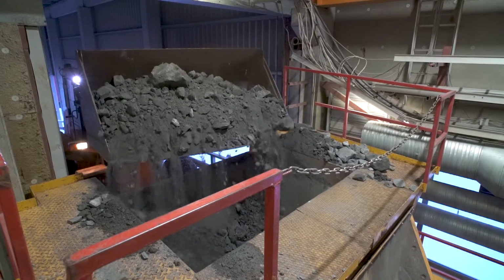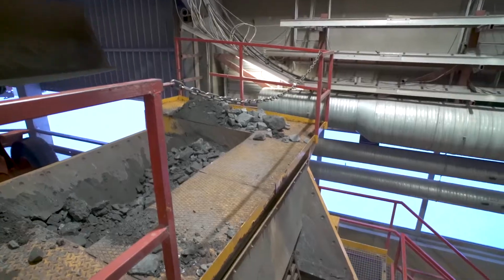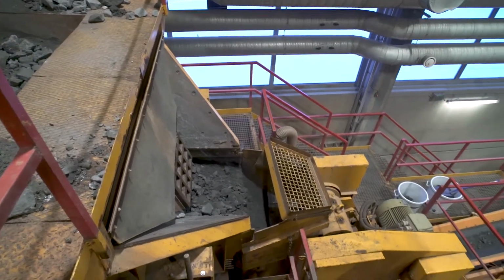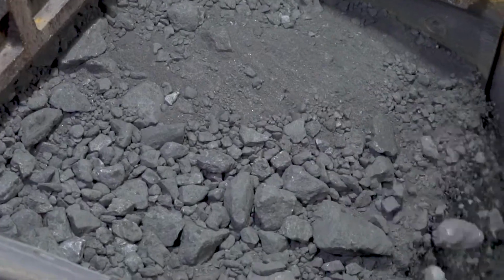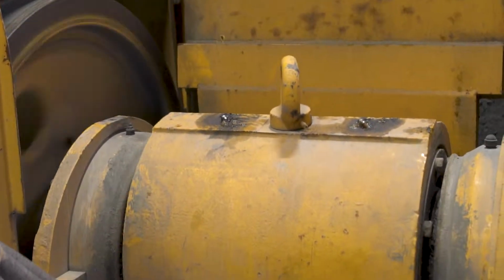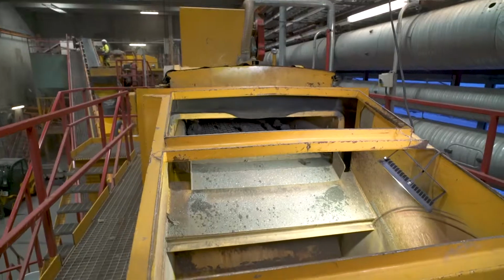Most ore samples for pilot plant operation come as blasted rock that requires crushing before it can be fed to the pilot plant process. The three-stage crushing circuit can crush up to 500 mm rocks and produce below 2 mm crushed material.